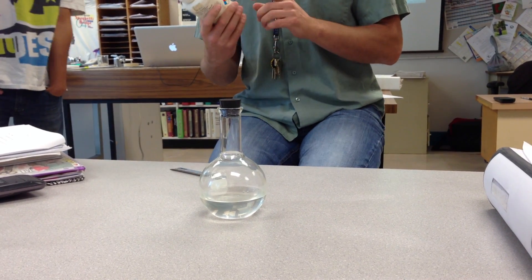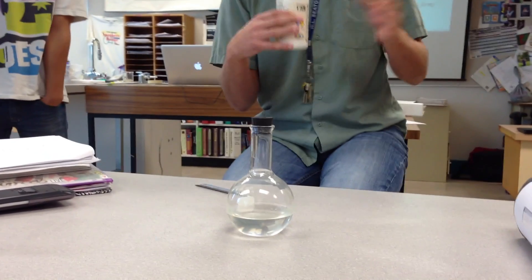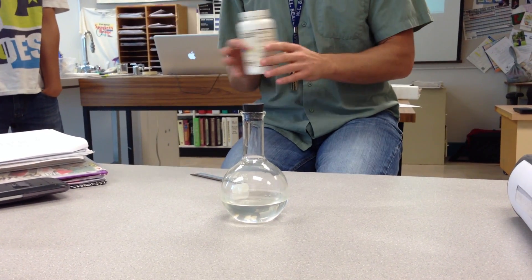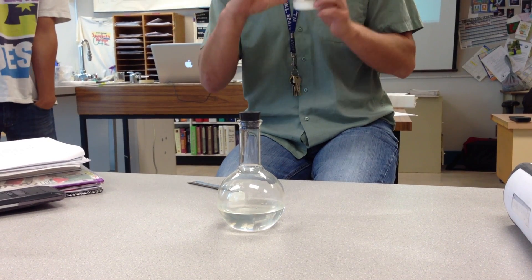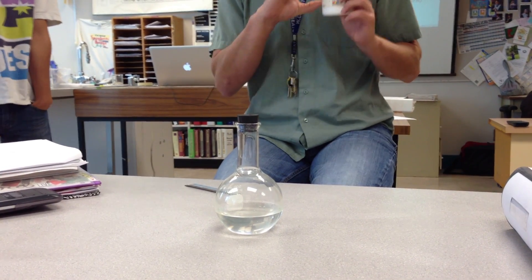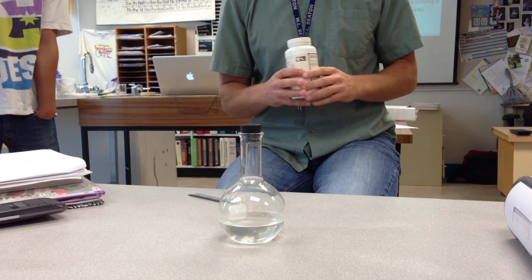It's actually a little more complicated than just dissolving — there is some decomposition going on and a little extra chemistry — but we won't worry about that. For now, let's just say that basically around 300 grams of sodium acetate dissolved in five grams of water, very carefully at high temperature.